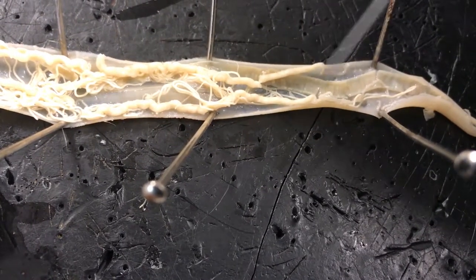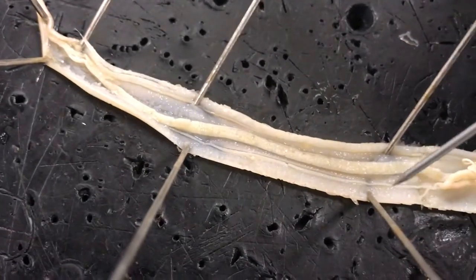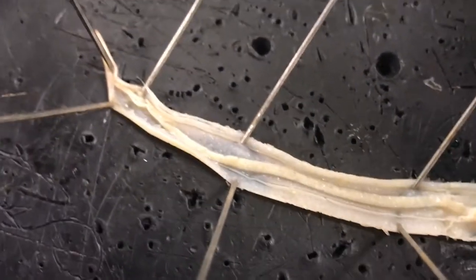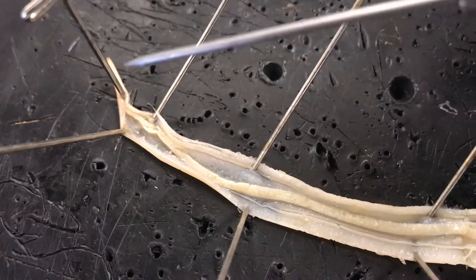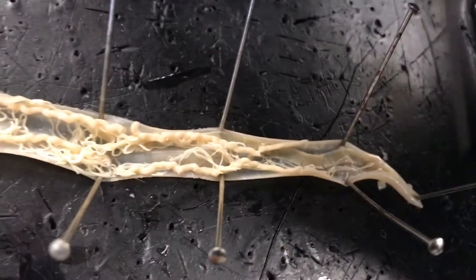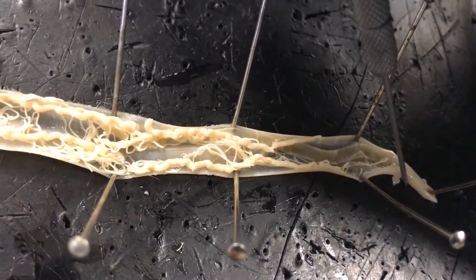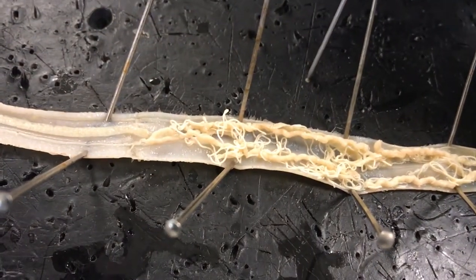If you also look underneath it right here, this ribbon-like structure that goes all the way down the body cavity — that is the intestines. The head is on this end and the tail on this end, and this would be a female roundworm.